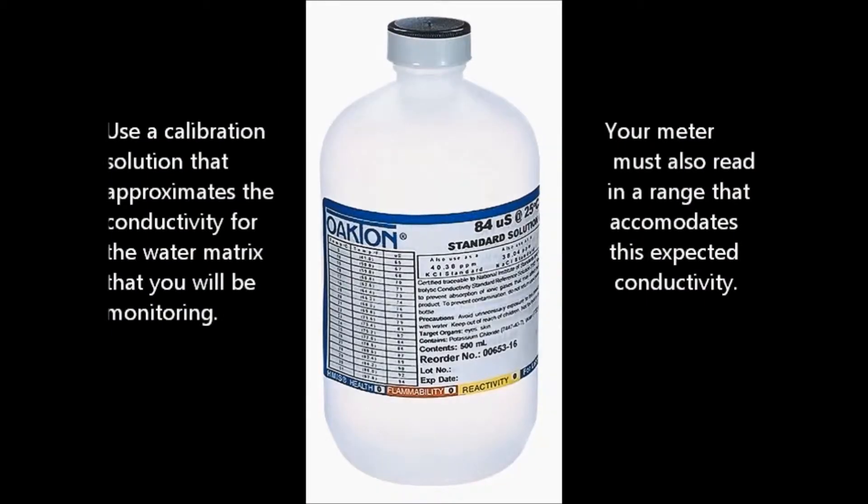Be sure to use a calibration solution that approximates the conductivity of the water you're going to be monitoring.